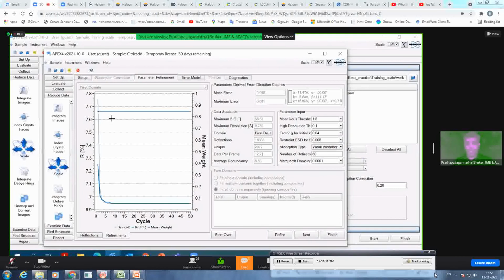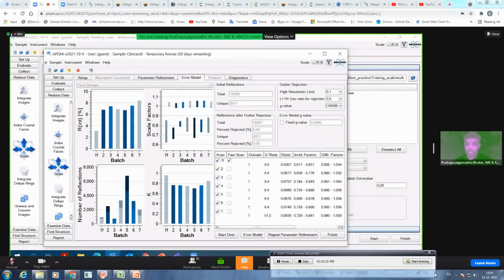And then along with that, if the scaling is going in a good direction, you get this scale mean weight around 0.8, 0.9, and so on. If it is lower than 0.7, consider that there is something wrong in your scaling, or with the data. Click on next. So you get the graphical information here: R internal versus the runs, scale factors versus runs, number of reflections for each run, unique and observed, and then K factor for each run. That is represented in numbers here.